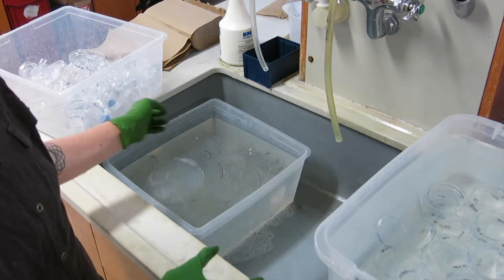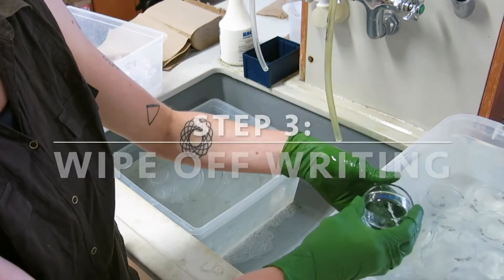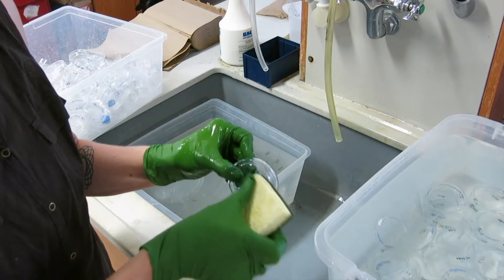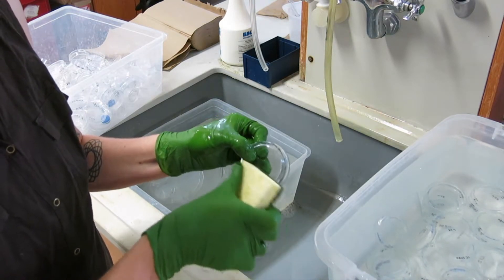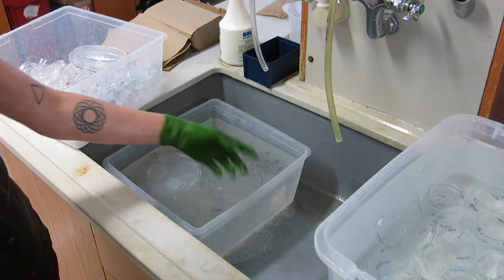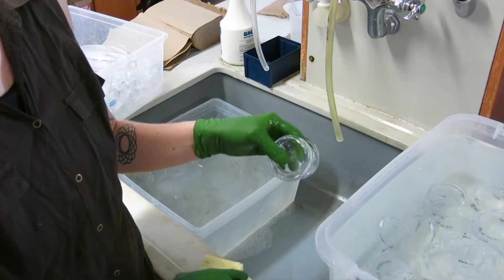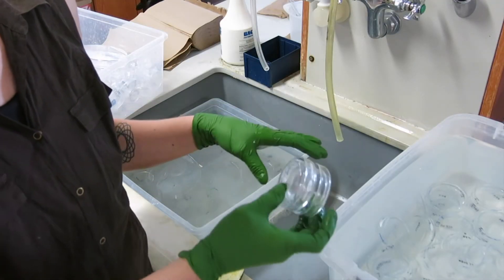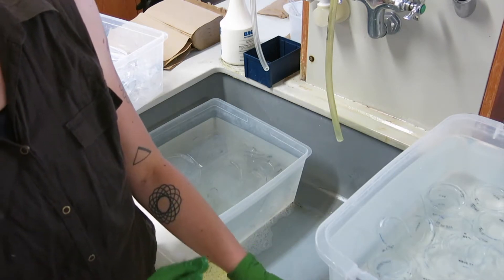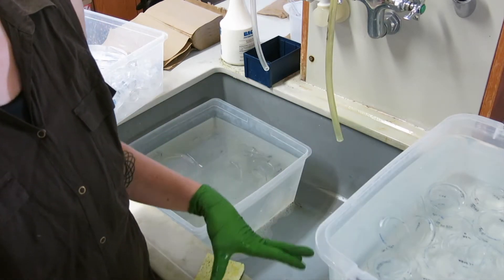These are the ones that were drying. After you've soaked them in bleach water overnight, you take them out and I use the green part of a sponge to get the writing off. With the plastic, I just take them out to dry, or you could let them dry and then recycle them. Then I take my petri dishes and sort them by size and put them into plastic bins, and then I communicate with my autoclave worker to get them dishwashed and autoclaved.